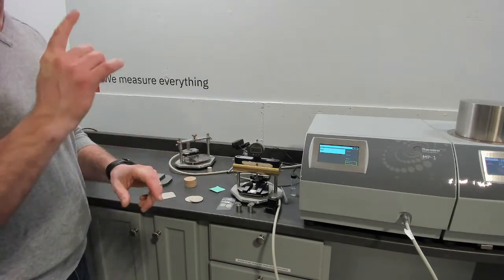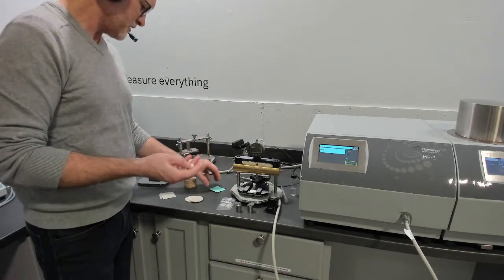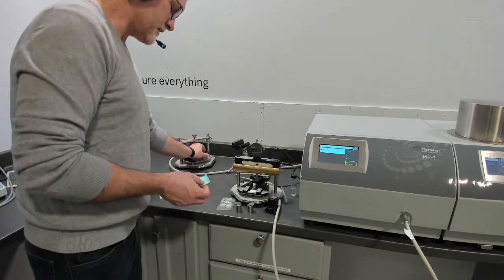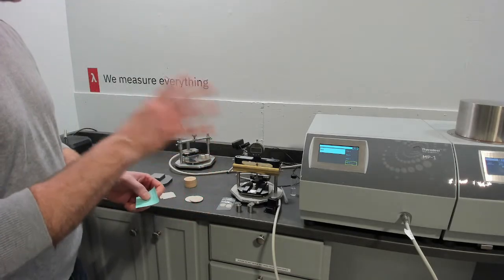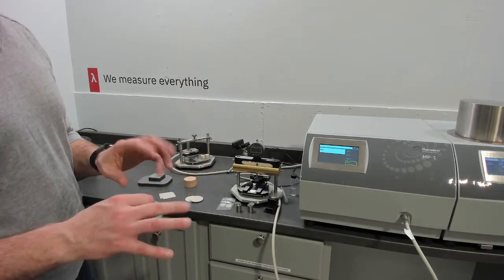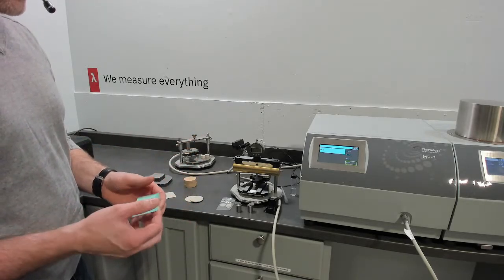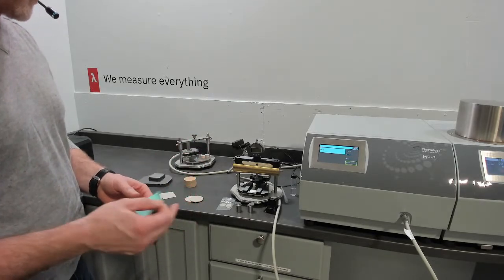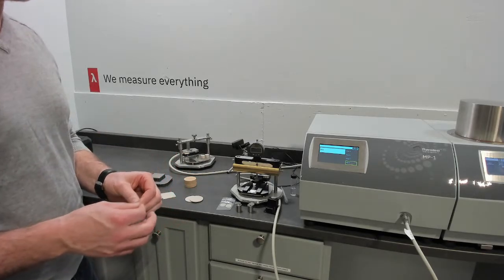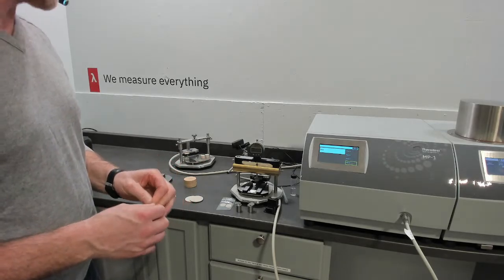So I'm going to go to the desktop and walk through entering the dimensions of the sample. We're going to show you how the ITPS works. So again, with all of our transient methods, we've added the intelligent transient element, which is the ability to automate all parameter selection with just inputting the dimensions of your sample. Of course, we're following the ideal theory, and you always have the ability to analyze raw data as an expert, but both levels of user experience we include. So I'm going to go to the desktop.